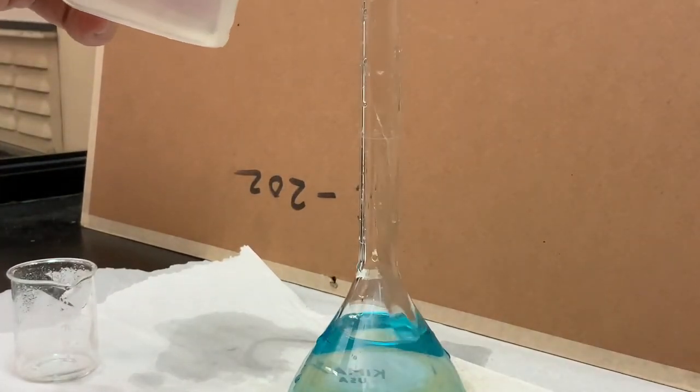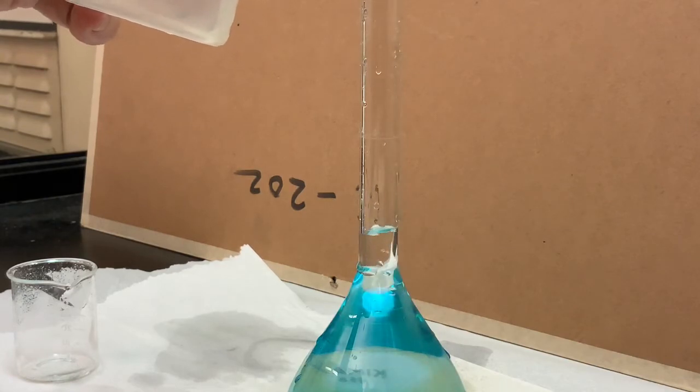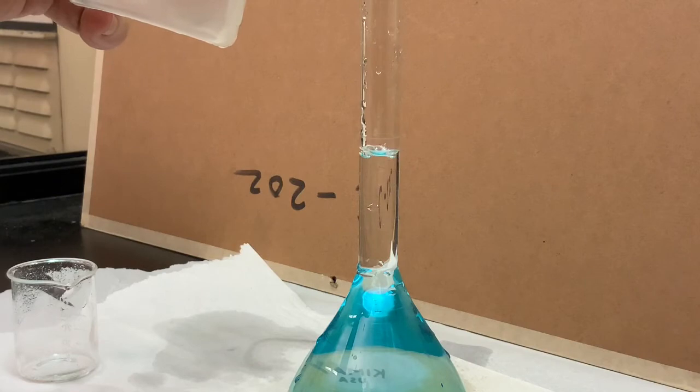You can just barely see it there. We'll zoom in a little bit, and now finish by filling the water right up to the line as best as possible, with an extra drop added in.